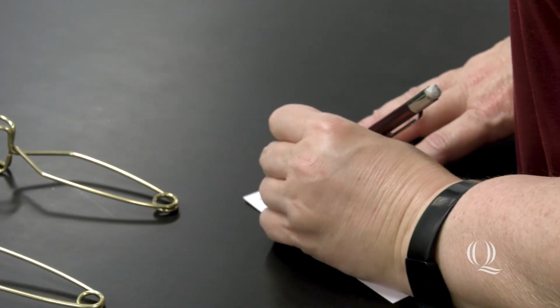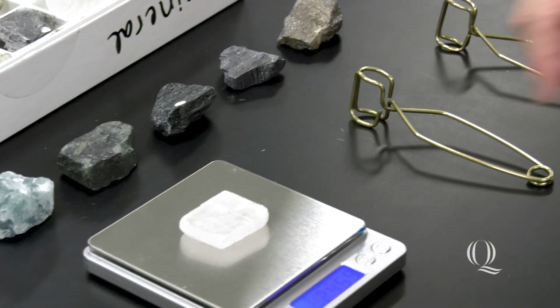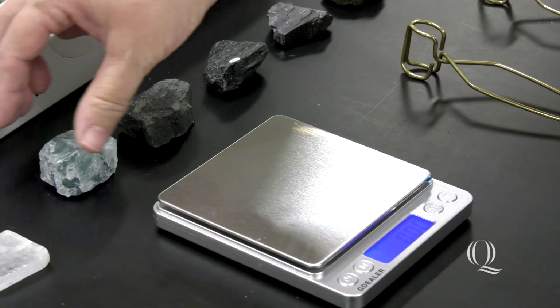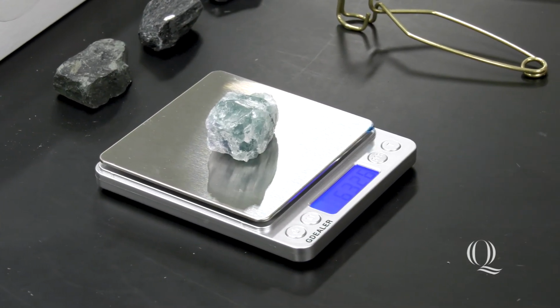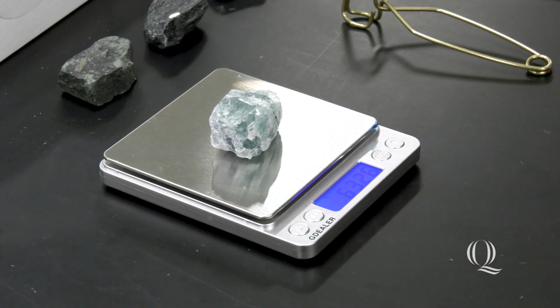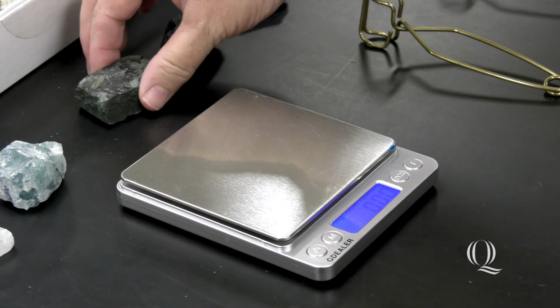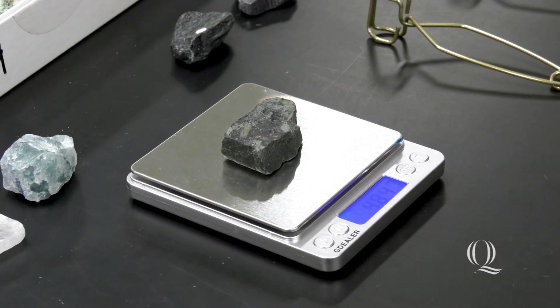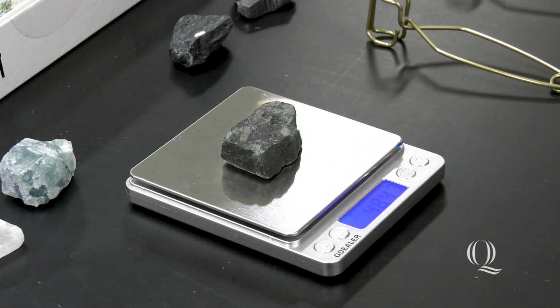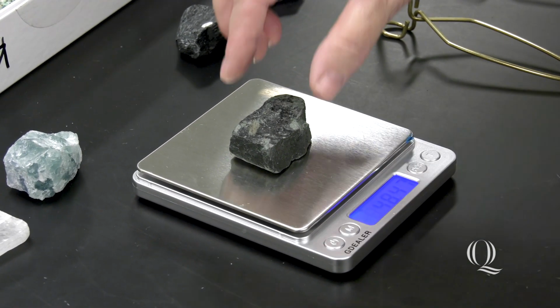24.59 grams. I'm going to do this and then I'm going to write it on the board. Sample number 4 has a weight of 63.26 grams, and as you can see, some of these samples are the same size, but they actually have very different weights, so it's just one of the properties of a mineral. Sample 15 has a weight of 48.47 grams.